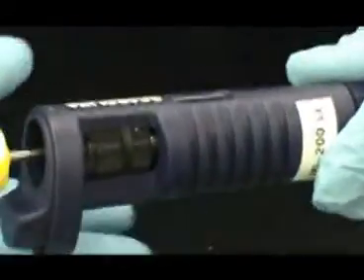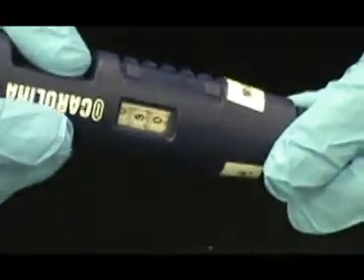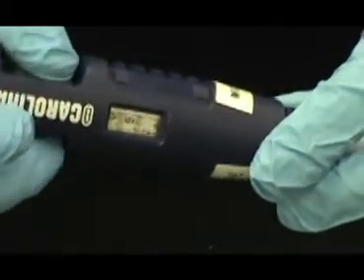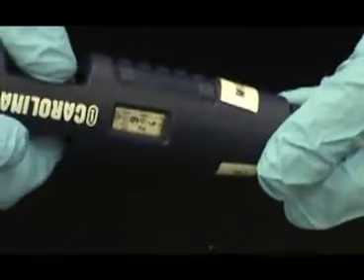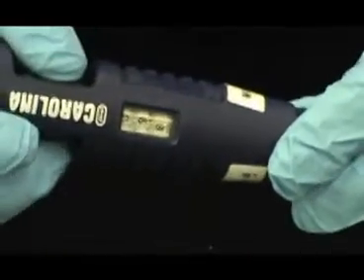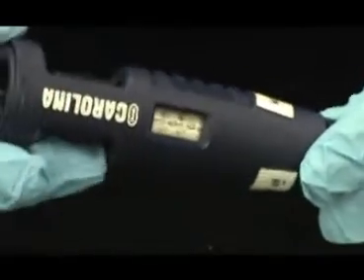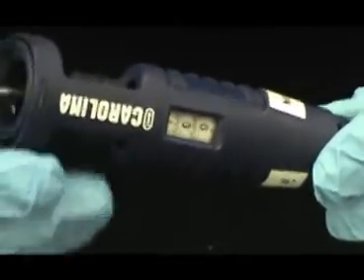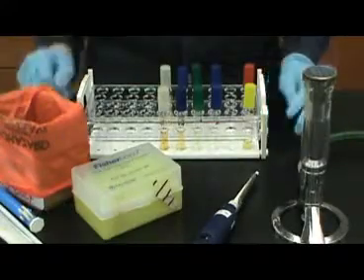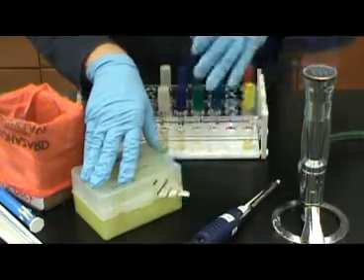Another way to inoculate each of the broths with 1/10 of a milliliter is using a micropipette. Be sure to set the micropipette to 100 microliters, since 100 microliters is 1/10 of a milliliter. When using a micropipette, you should practice with the pipette first before actually using it for inoculation.